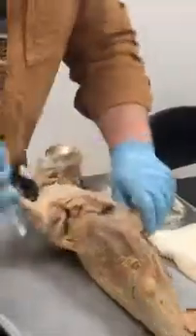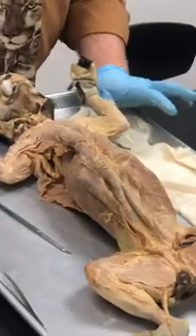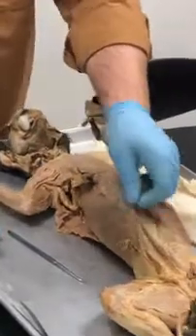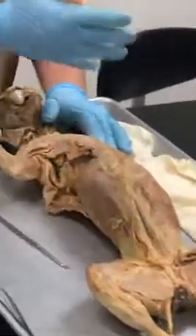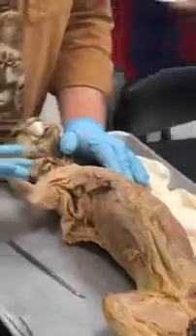Okay, so let's talk about the chest. And the chest isn't so bad. There are 4 muscles of the chest, 2 of which are unique to the cat. I picked those for a couple of reasons. One, because they're so obvious to see. And also, you have to move them out of the way to see the human muscles. So I might as well just give them a name.